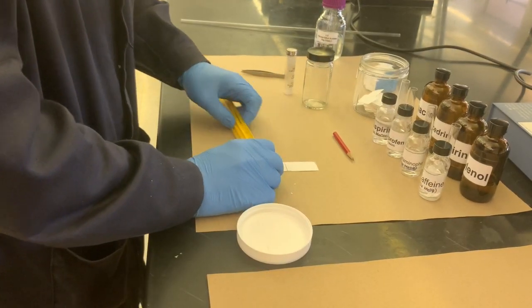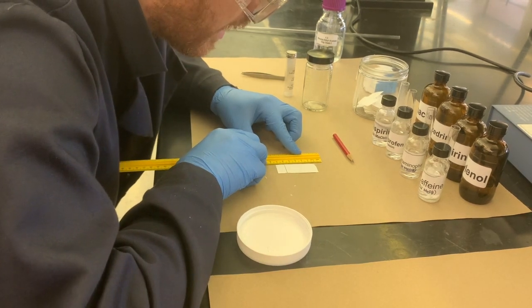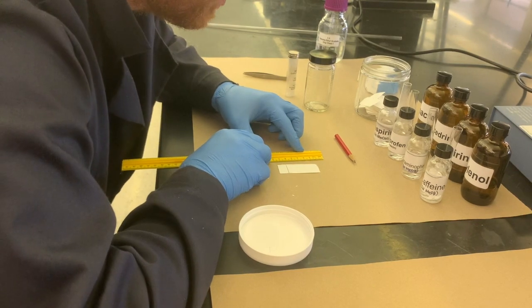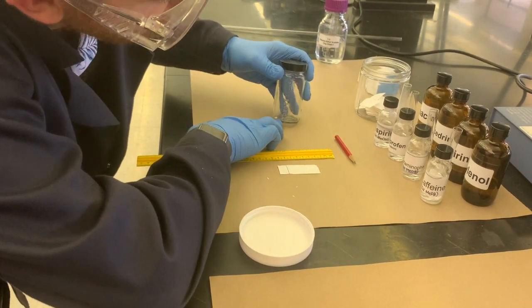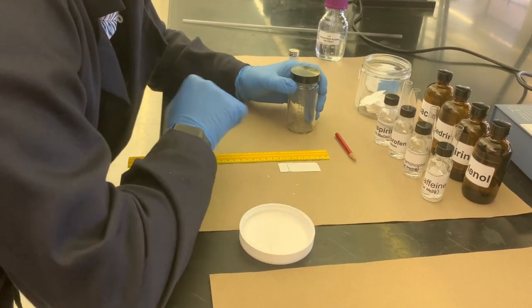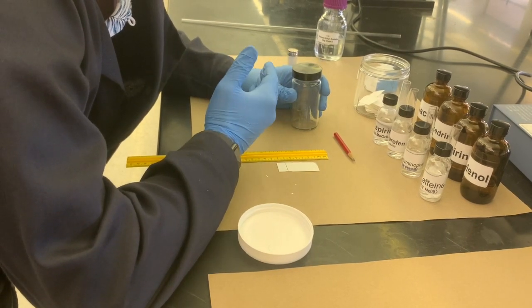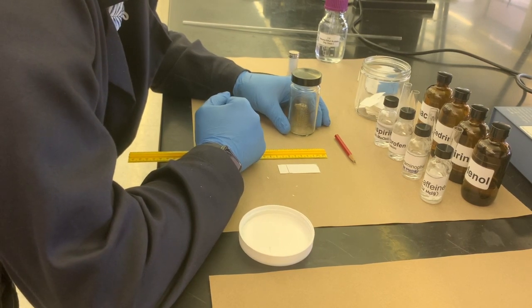One reason that I actually worked with this ruler to plan about 1.5 centimeters to start is because you don't want any of the solution that we're going to use in our TLC chamber to ever overlap over the sides or splash up onto the TLC plate. That could prematurely start the actual process of the TLC and negatively affect our results, creating less separation.